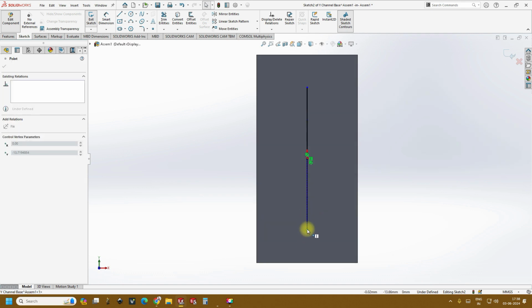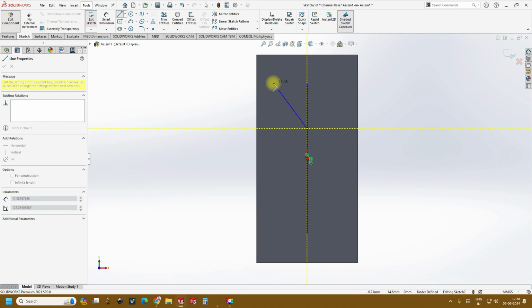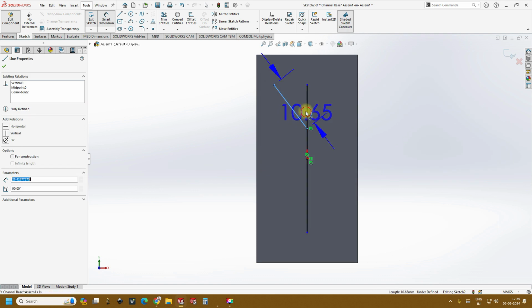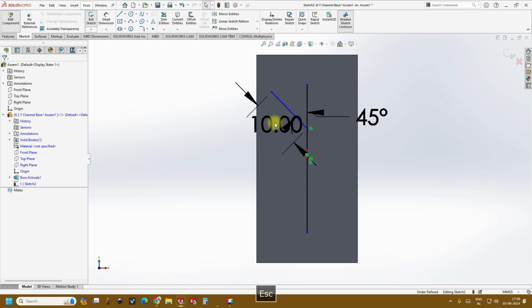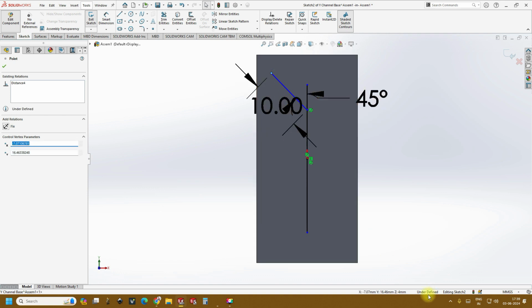Now you just drag it so you can see this, right? And then in the same way create a line, and then give the smart dimension between these two as 45 degrees, followed by the dimension of this around 10 mm, and just see which direction it is moving. If you click and hold this point, you can see where it is moving, and that is the reason it is underdefined.